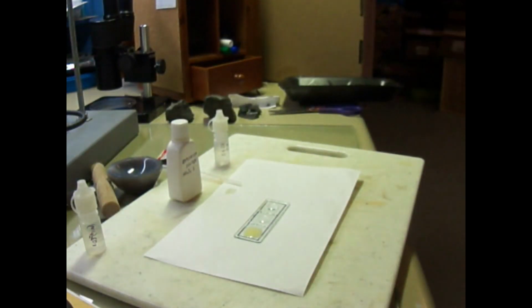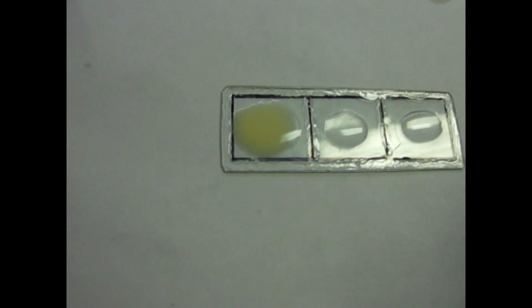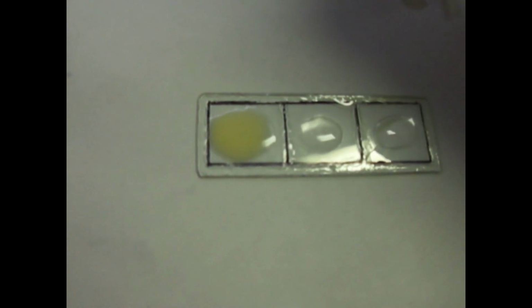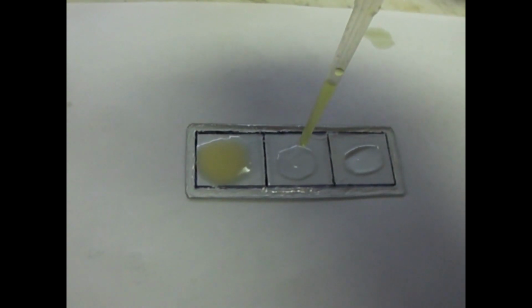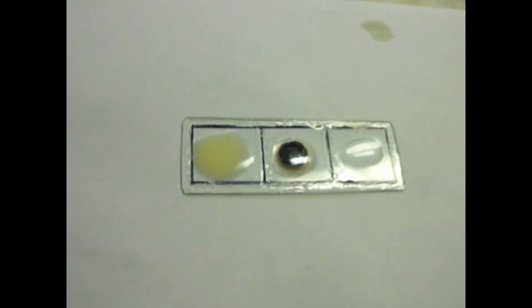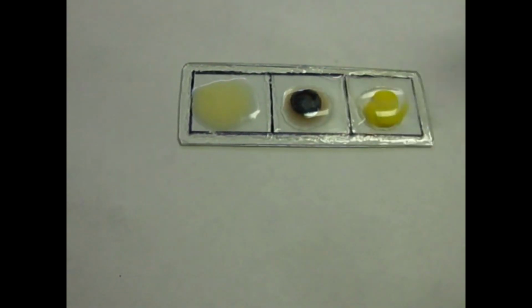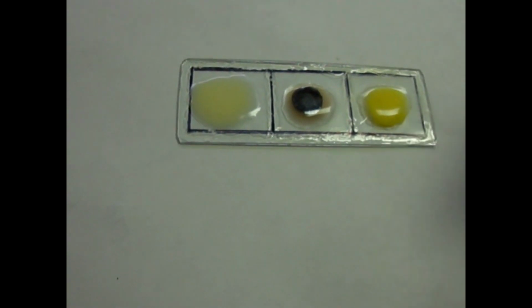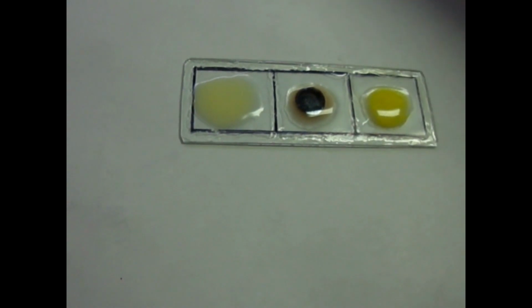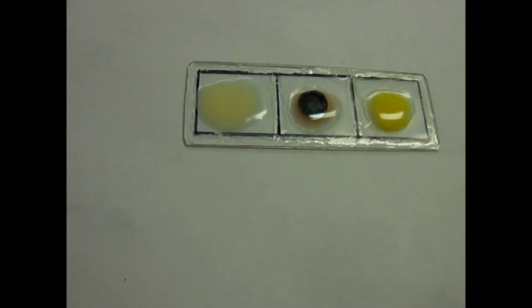And I don't know if you can see that, but it's kind of a whitish, it's a bit more of a beige, but definitely a precipitate. Now we're going to add a drop of ammonium sulfide to the middle one. Wow. Definitely black. And the last one is potassium iodide. Wow. So the potassium iodide, or the last test, is kind of a standard confirmation test. The other 2 definitely confirm it also.